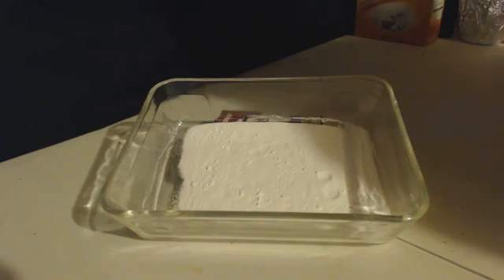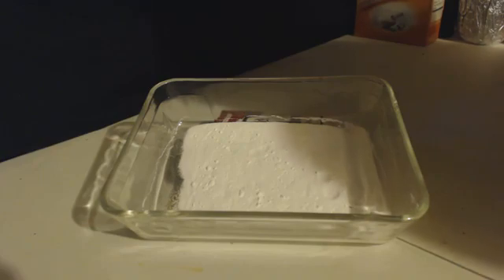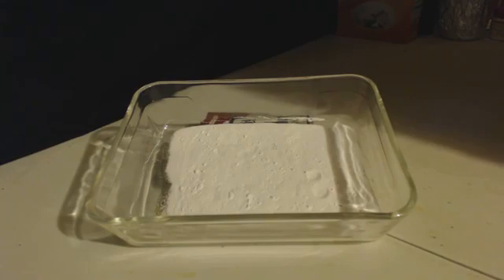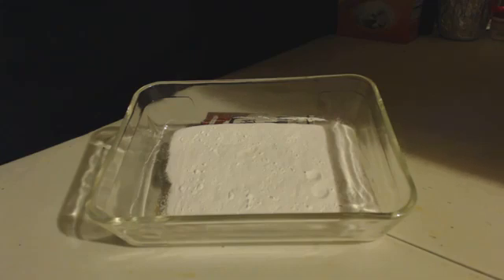That way it won't take you hardly any time. If you put a cup of water in an oven it's almost impossible to boil it away, it takes days, you'll be there for eight hours trying to boil it away. But if you just have like a millimeter of water on a one foot by one foot or two foot pan with all that surface area, just a millimeter high, it'll evaporate pretty quick comparatively.